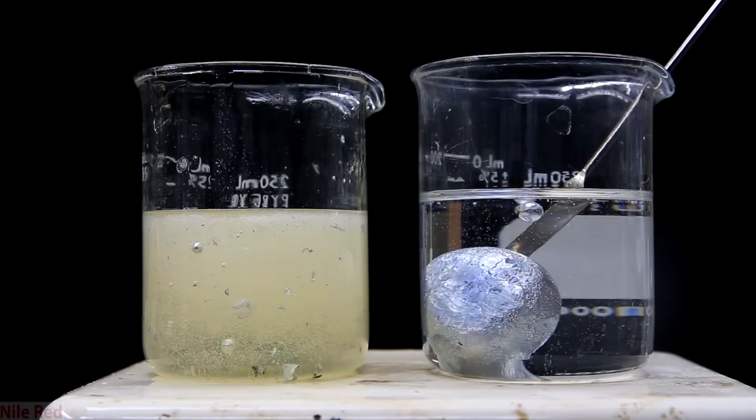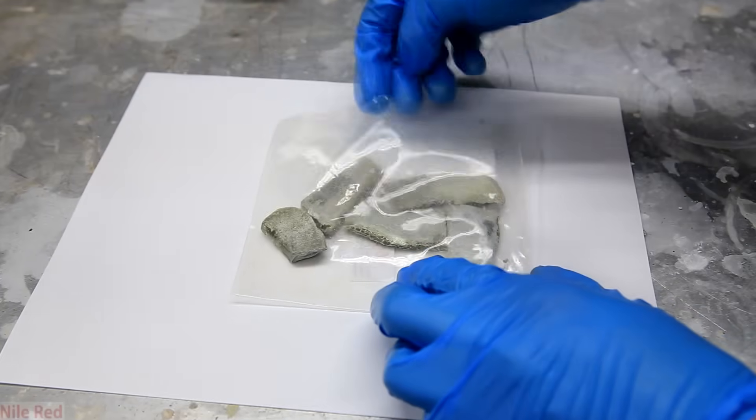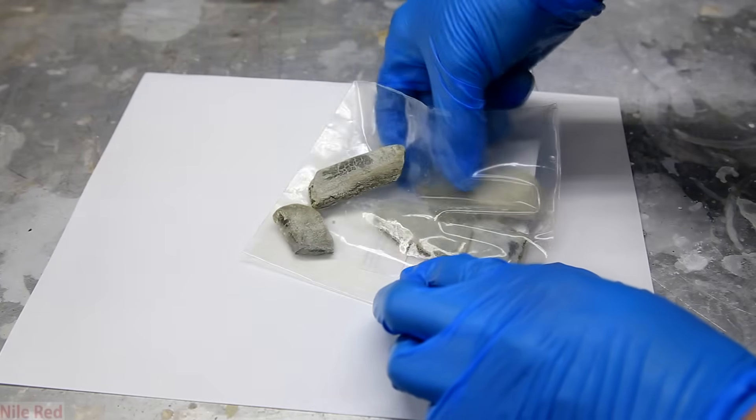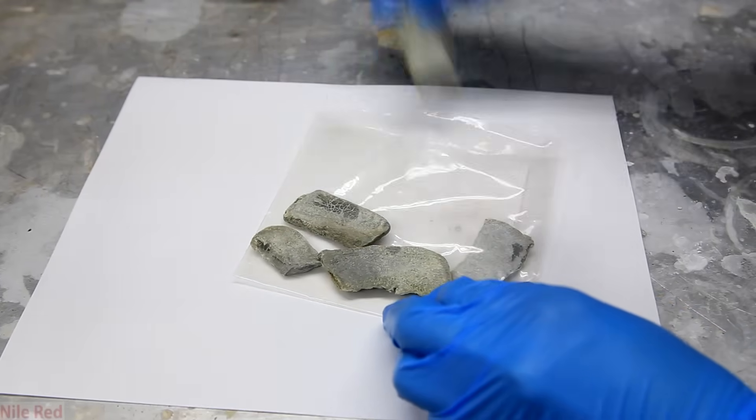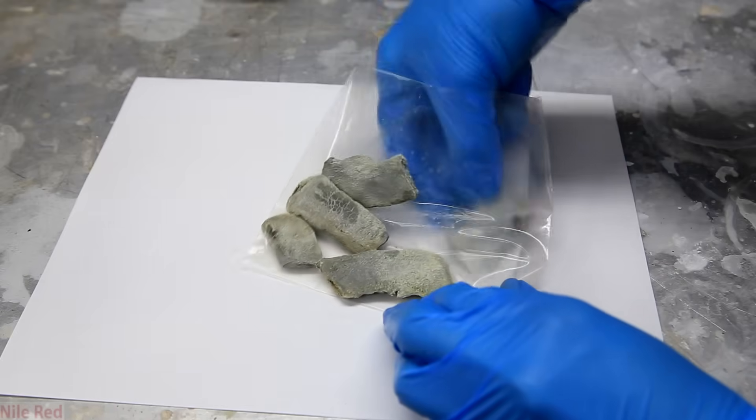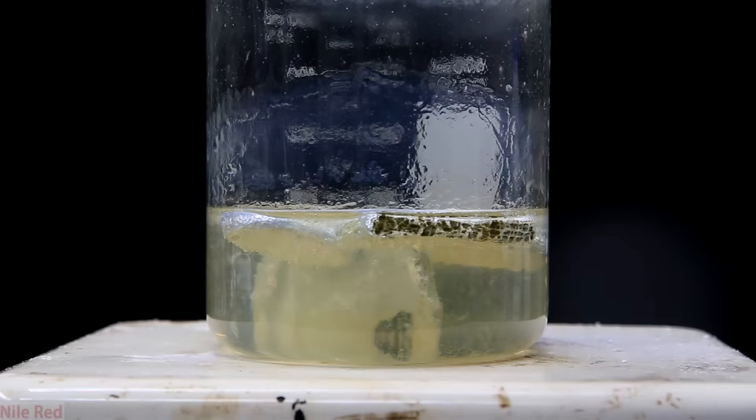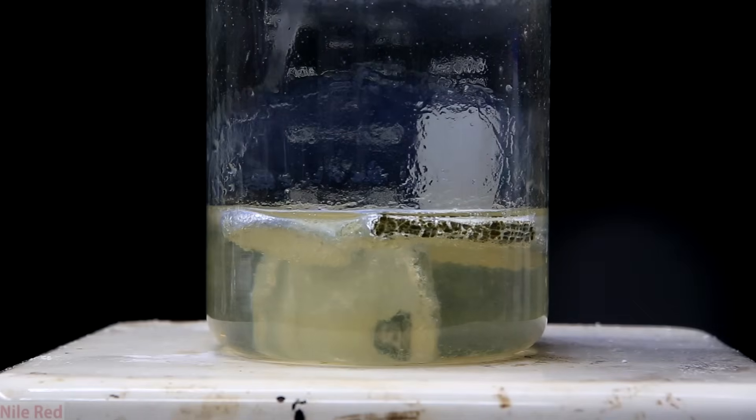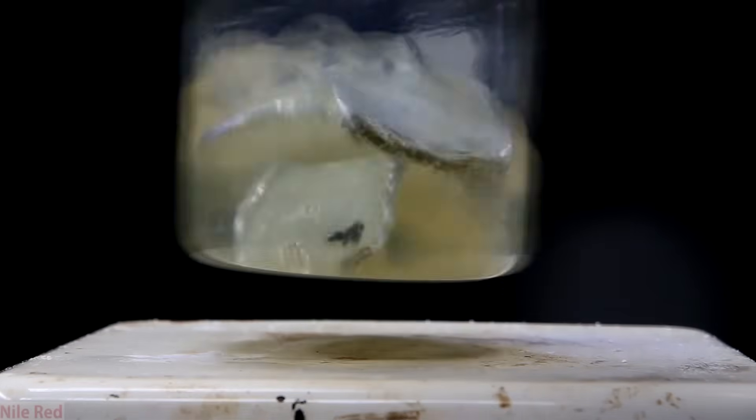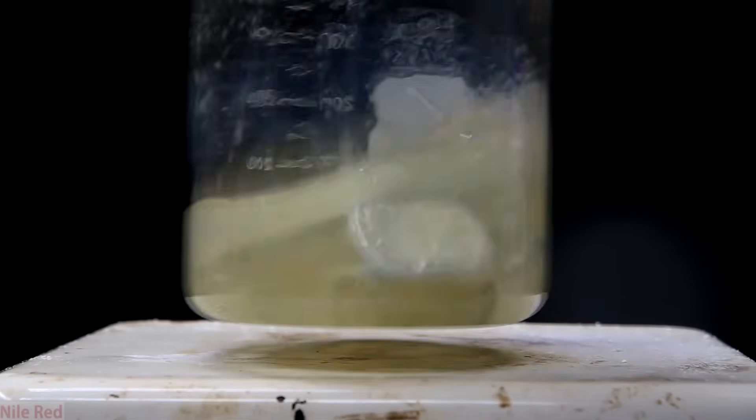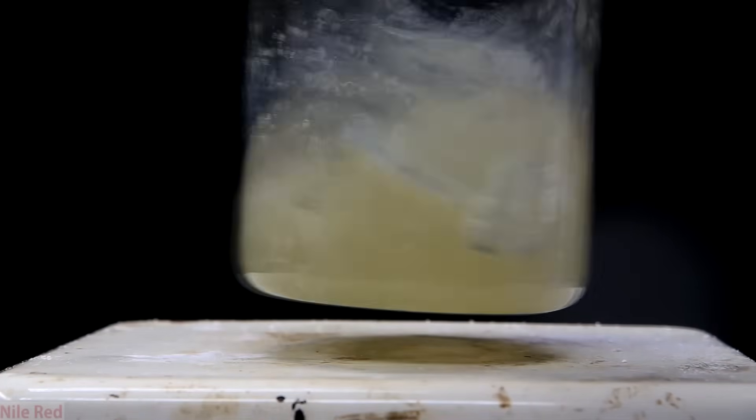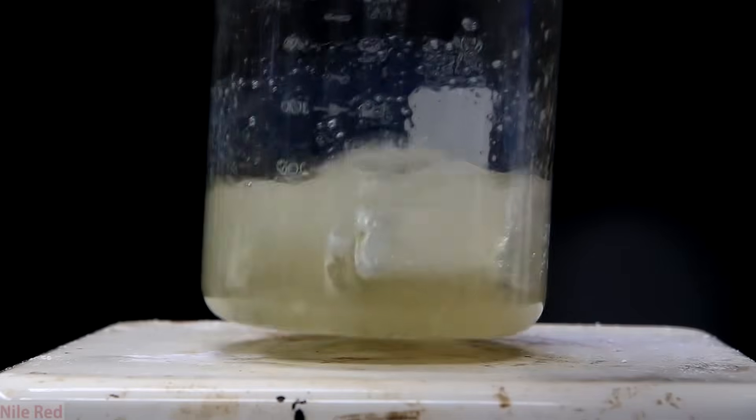This is all assuming that you're going to be cutting the potassium dry, but it's often stored in oil and this actually poses a second problem. If the potassium still has the mineral oil, kerosene or other organics on it, it can react with the superoxide when it's cut and also ignite it. So you can see why you have to be careful when you're working with old potassium because you really don't want a potassium fire.